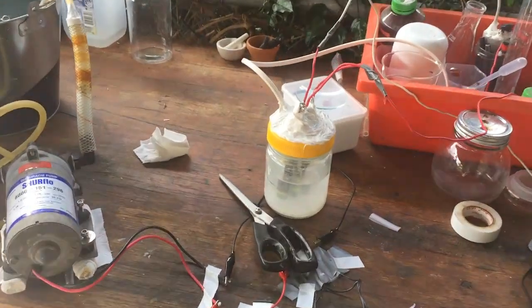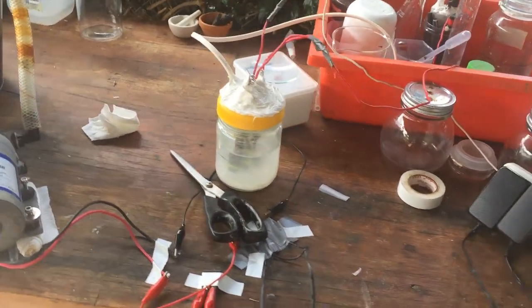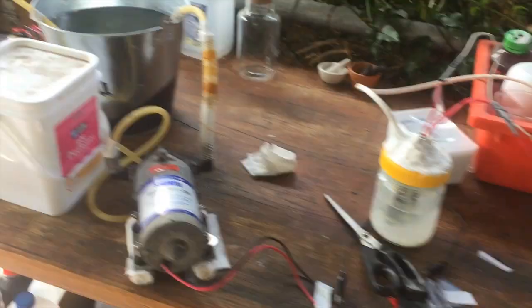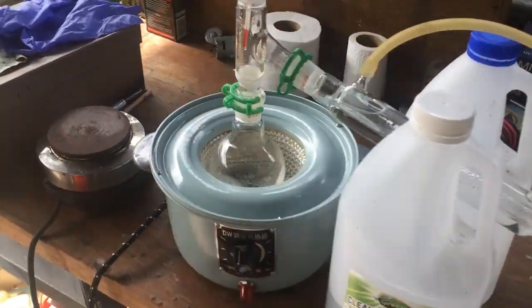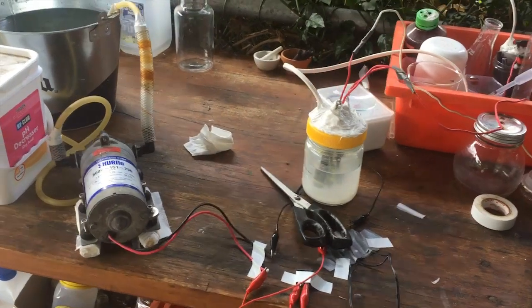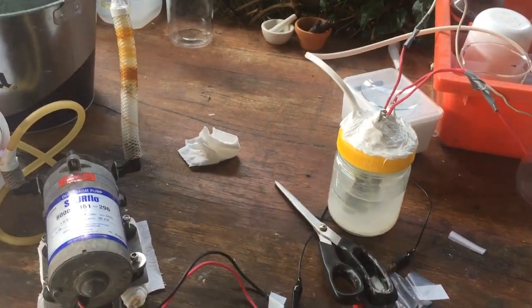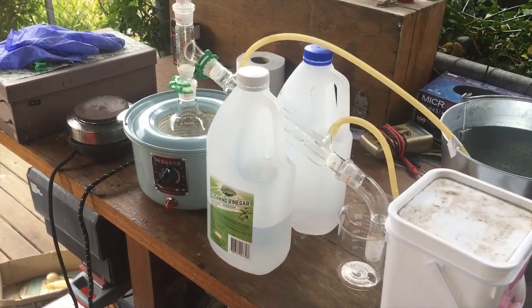Honestly, it's been over a full year since I started this heavy water concentrating, and we're getting very close to the end, so I'm quite excited. We started off with 20, 22 litres of regular water, and now we're down to 600 mils — we're so close.